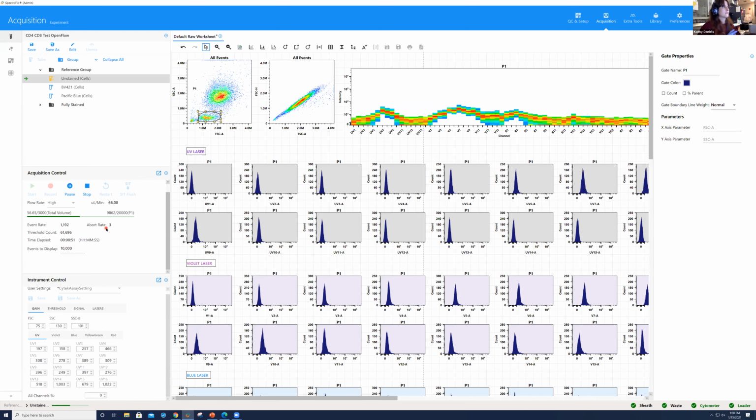Yeah, exactly. So ideally what I would like to do, right, is to concentrate these cells and run them at a lower flow rate. I'm working with lyophilized cells that aren't too concentrated and working with small numbers of cells. So I kind of had to work with what I had, especially taking into account that I wanted volumes that we could talk through things and I could yammer on and on talking about these different principles.